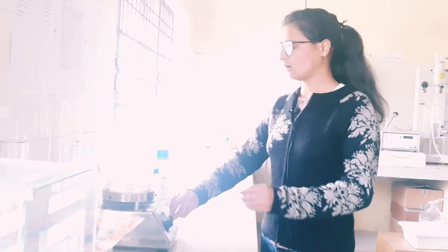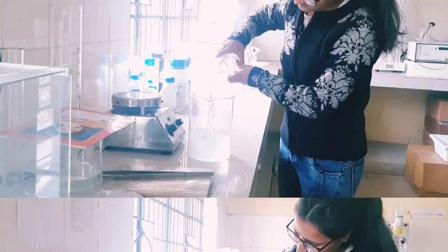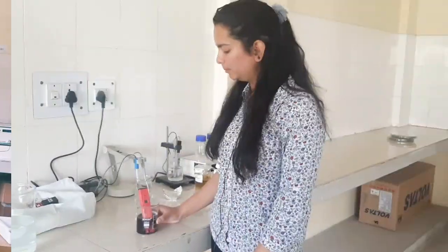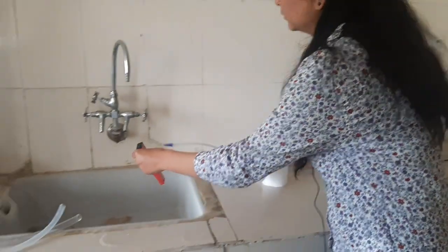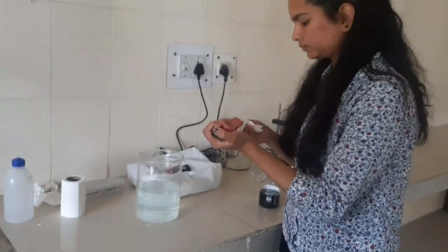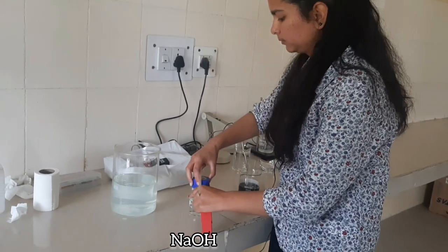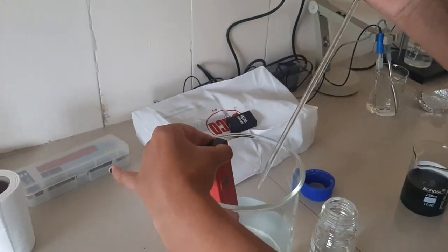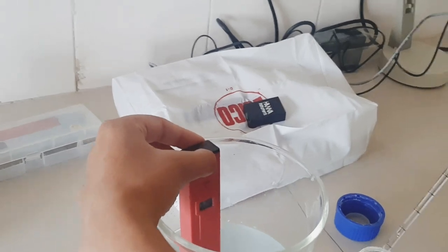Now it has dissolved, and now we will add 900 ml for the volume make-up. Then we will dissolve it — our pH meter has been calibrated on the proper solution. We will wash it with distilled water. Now we will maintain the pH of the media. The target pH of the media is 5.8.